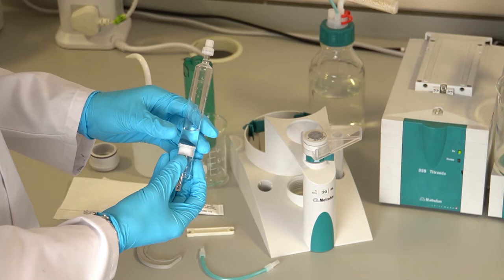If there are any precipitates around the piston then do not remove it as this may damage the glass. Instead use a suitable solution to remove the precipitates. If the cylinder is scratched then it must be replaced.